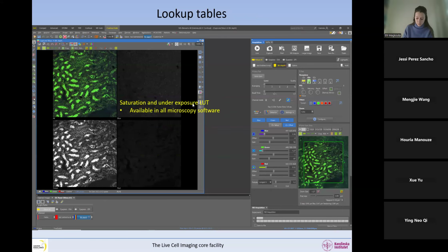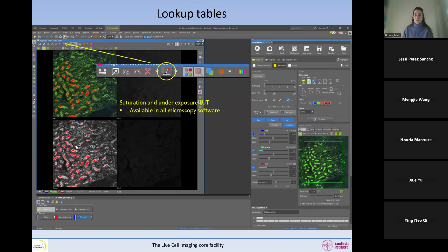So the saturation and underexposure lookup table is available on all microscope software. Please use it. I think it's good to have it on all the time. And if it bothers you that the image is red, just do something about it and reduce everything so that the red disappears. And then it will not bother you anymore, but at least you will not be saturated.